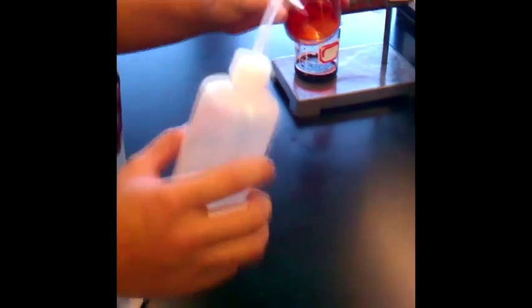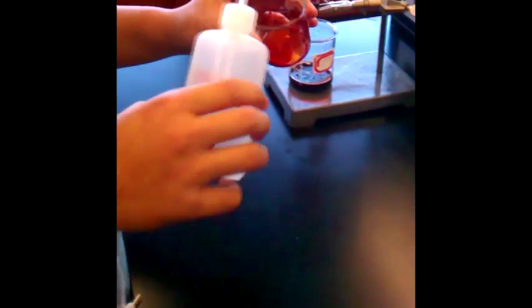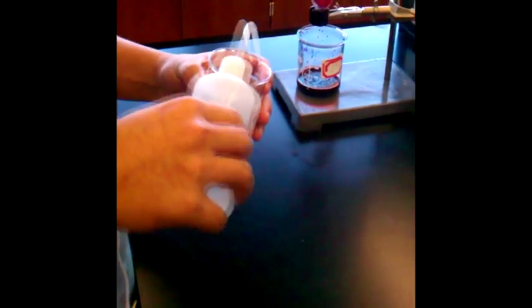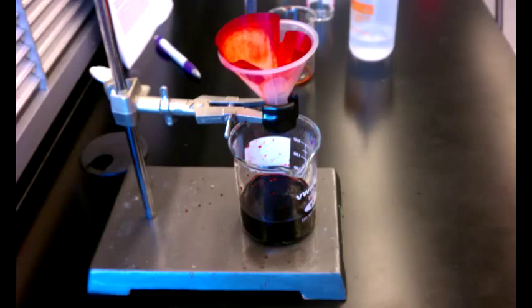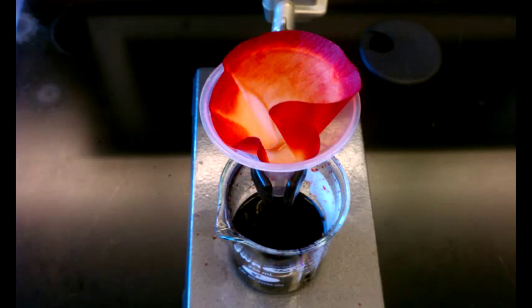If there is still some residue left in the 50 mL beaker, use a wash bottle to spray some DI water to rinse it and pour it into the filter. Be aware that the more DI water that you use, the longer you must wait when you boil the solution. You should also rinse the filter paper with DI water to get as much of the solution as possible.